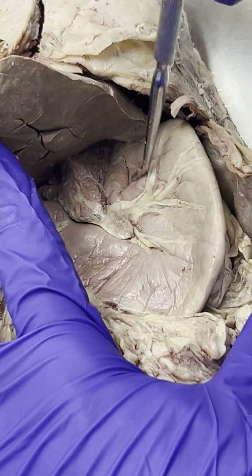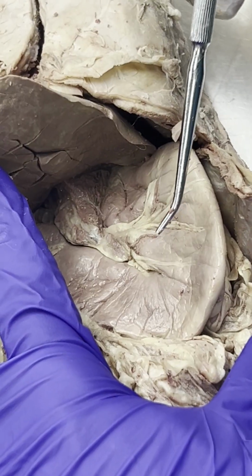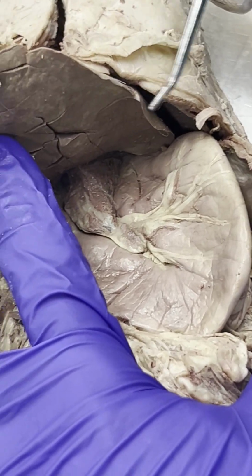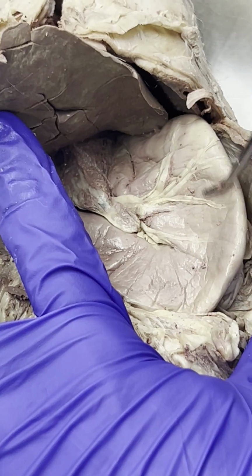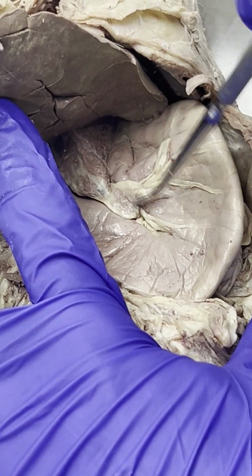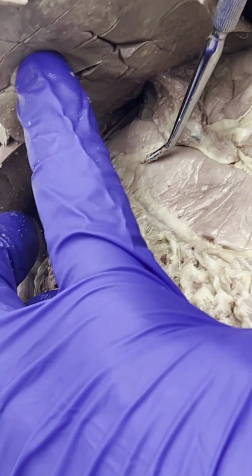And if you're a Star Wars fan, there's the inner rim of the galaxy and the outer rim of the galaxy. That's kind of how I think about it. We have the body of the stomach, which is a structure that you guys need to know. It's this large caudal section of the stomach. So body of the stomach, large caudal section of the stomach. And then we also have the pyloric region of the stomach, which is going to be around here.